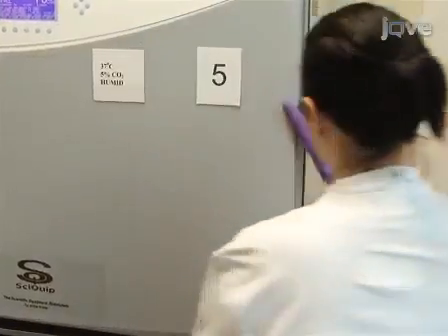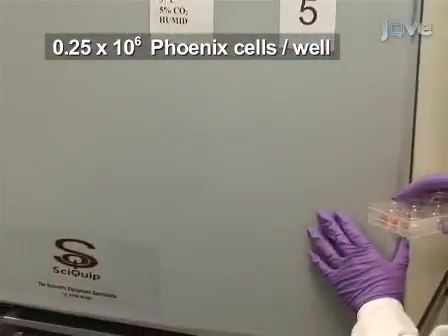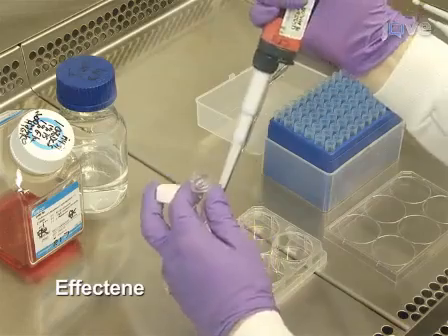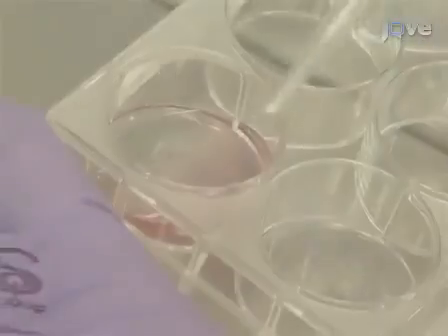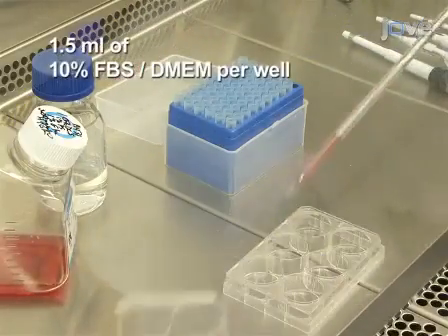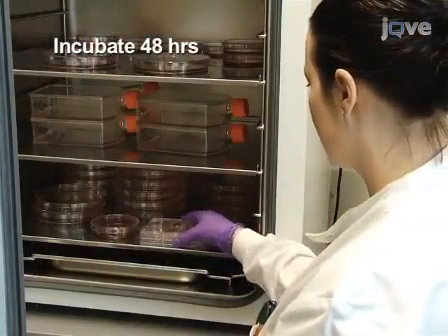Culture retroviral packaging cells in DMEM containing 10% FBS for 48 hours. Transfect the cells with retroviral DNA according to the manufacturer's instructions. Incubate for 24 hours. Rinse the wells twice with medium, then add 1.5 ml of 10% FBS DMEM per well and incubate for 48 hours.